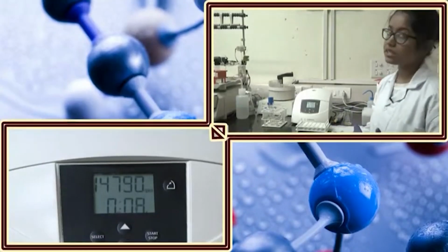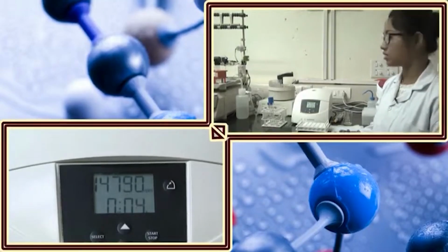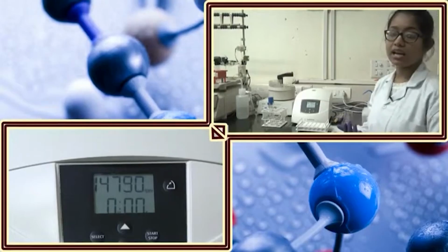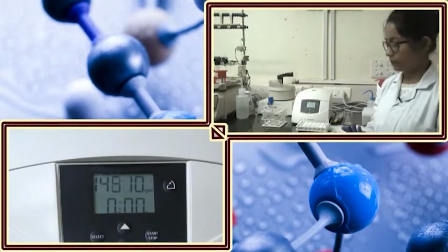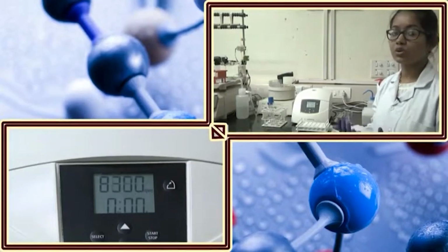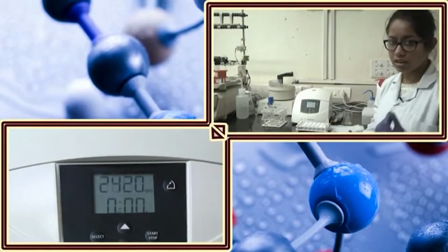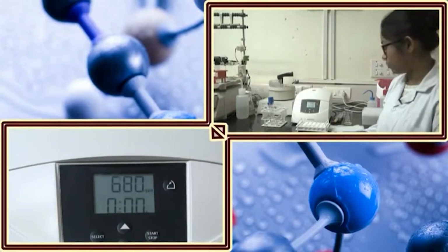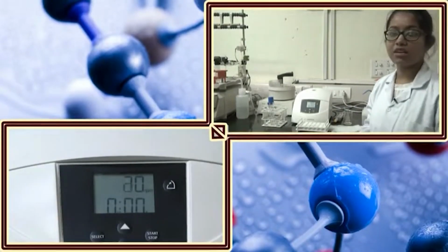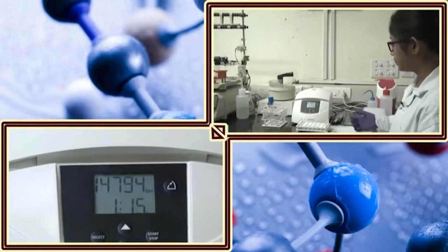So, if the bacterial strain contains low copy number, then the yield will be less. For those cases you need to go for higher culture. If the bacterial copy number is very high, then 5 ml to 7 ml is fine. Also, it will depend on what kind of subsequent work you will do with the plasmid. If you want to do PCR, a very small amount of DNA is okay for your experiment. If you want to do restriction digestion, any kind of ligation or transfection, it will change depending on your necessity.